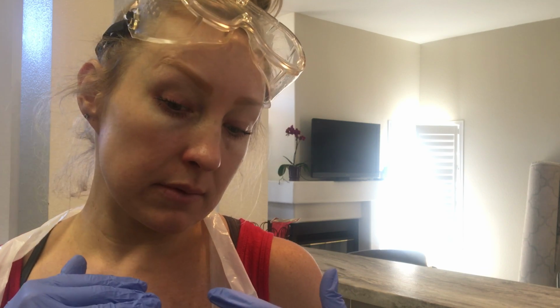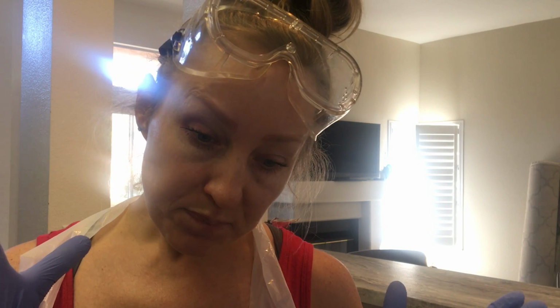What's our field of view? It always ranges depending on what we're looking at or how close we want to be. Obviously, the smaller the bacteria or amoeba, I can never say this, amoeba, you might want to be closer or further away depending on the stain. Well, amoebas don't have stains, but you get what I'm saying. Different organisms may need a broader or a lesser field of view.